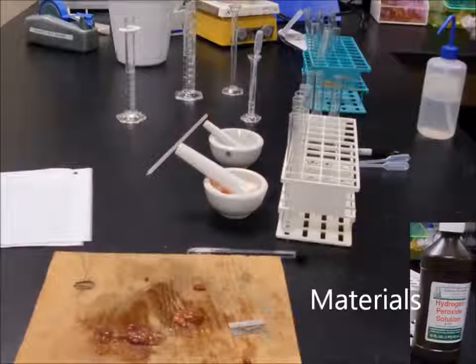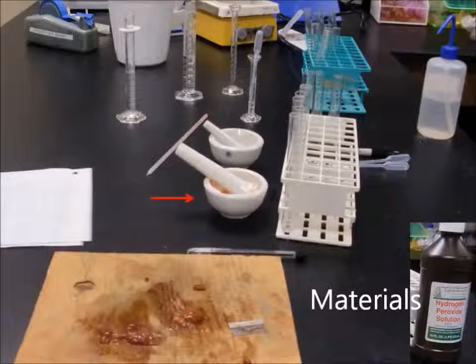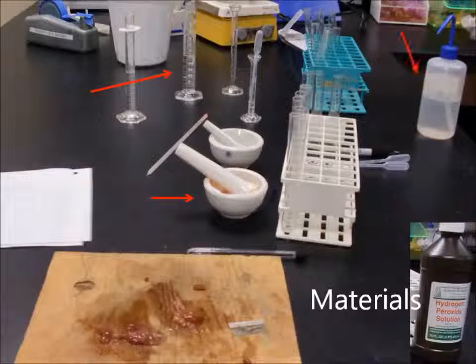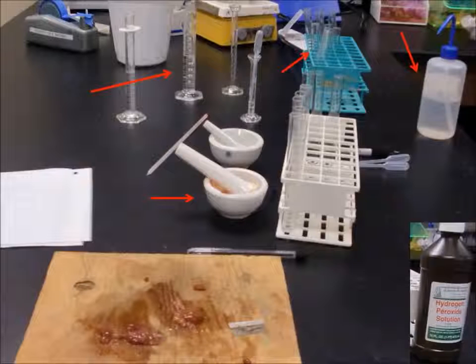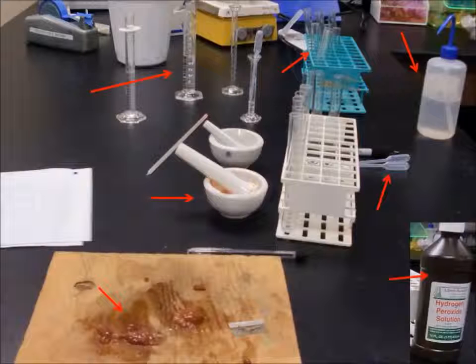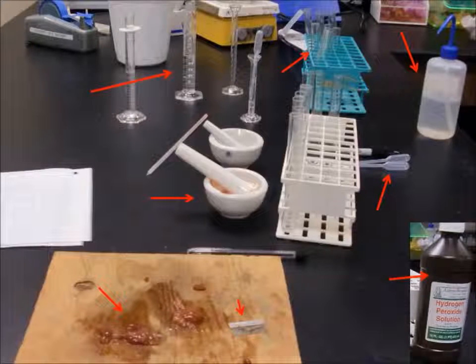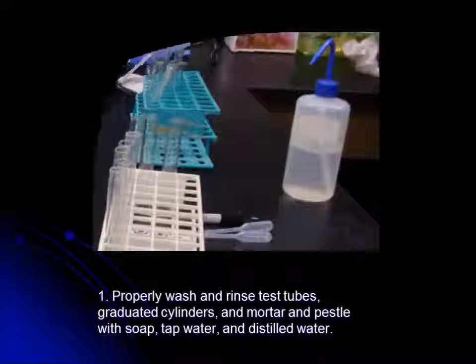Materials for this lab include mortar and pestle, graduated cylinder, distilled water, test tubes, chicken liver, transfer pipettes, hydrogen peroxide, razor blade, and cutting board.